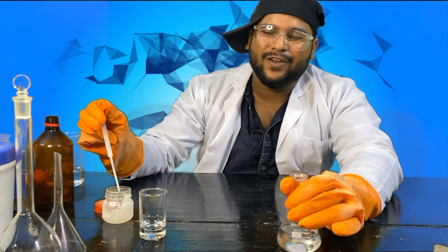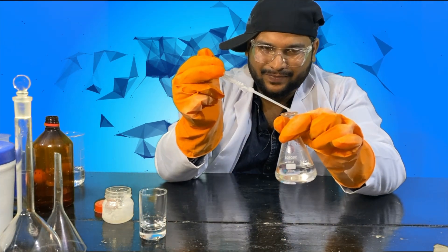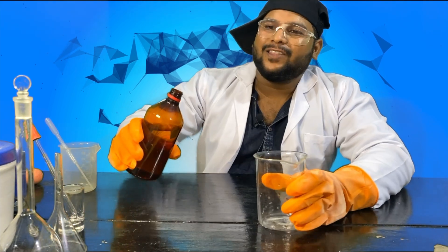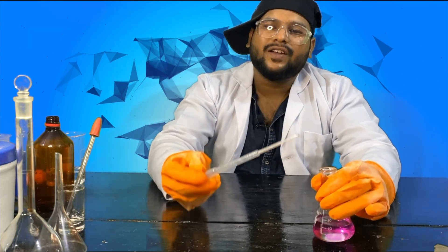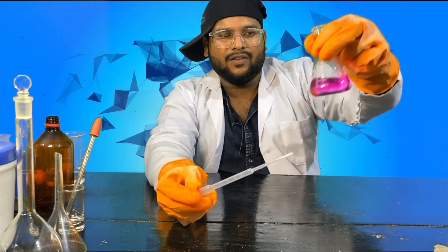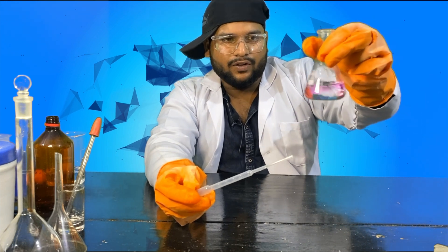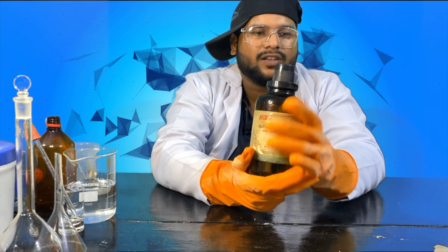Imagine a world where a drop of science can make a difference — this is chemistry. Hello and welcome back to Lethalia, your go-to channel for all things chemicals and curious. Today we are diving into the fascinating world of dilution, and we are going to prepare a precise 0.1 molar sulfuric acid solution.